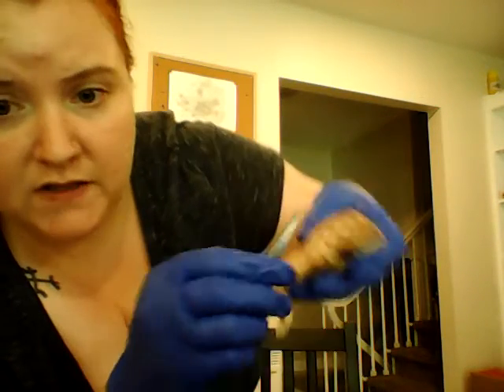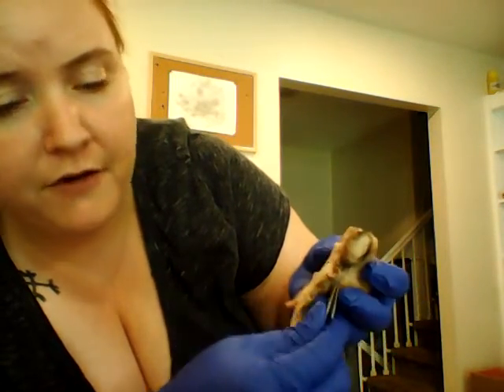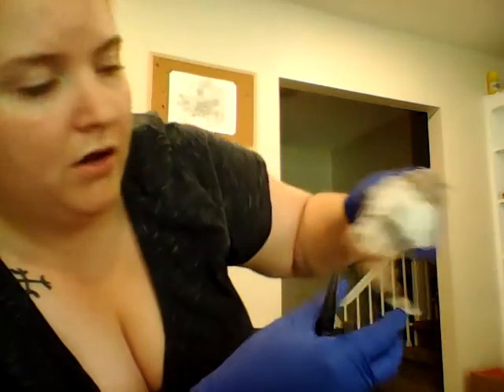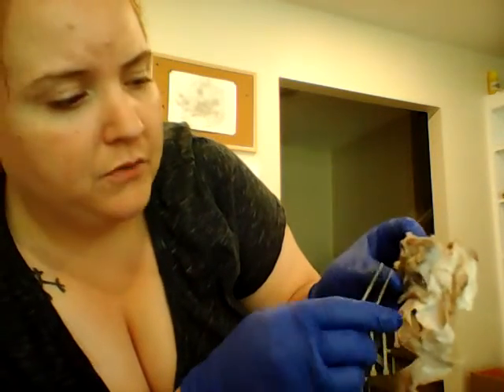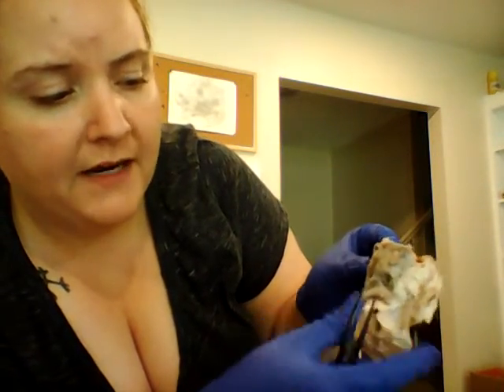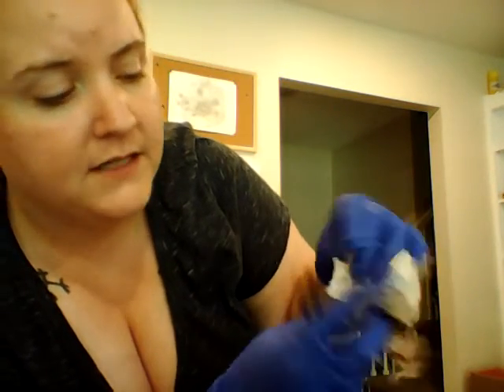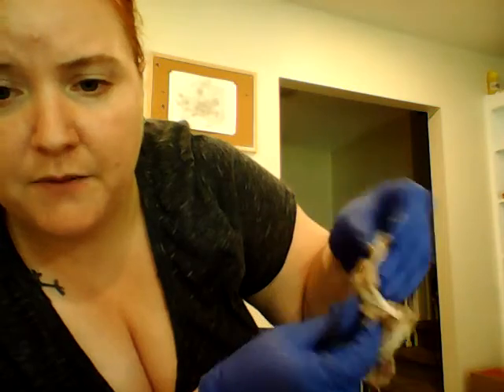And then the meninges are what goes on the outside. You can kind of see just a little bit left over here. It's the lining of the brain, and it all pulled off like this. This is all the meninges that came off. With the dissection, when I pulled the meninges off, the optic chiasm and all of the structures on the outside here came off with it. It just kind of slipped right off as I was doing it.